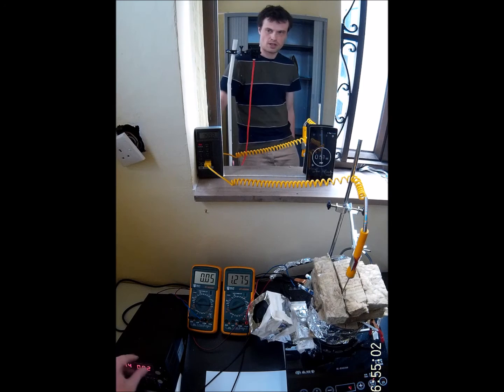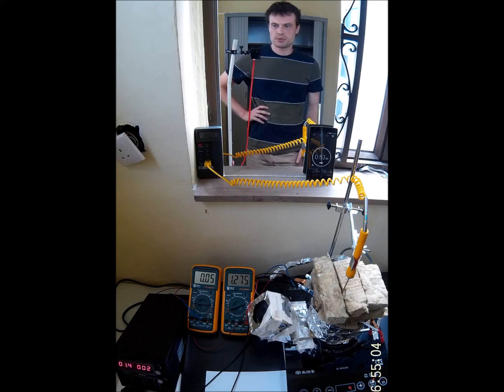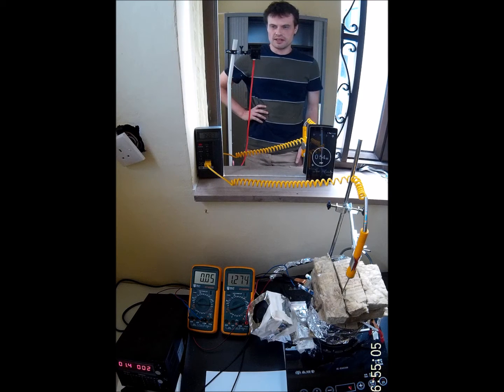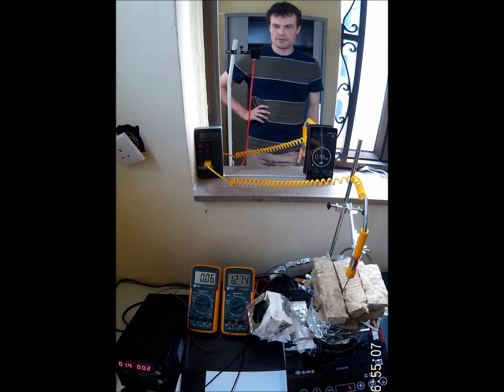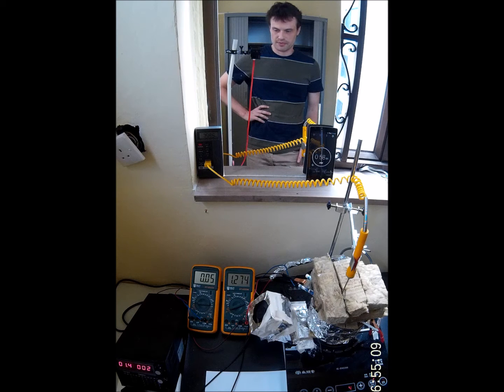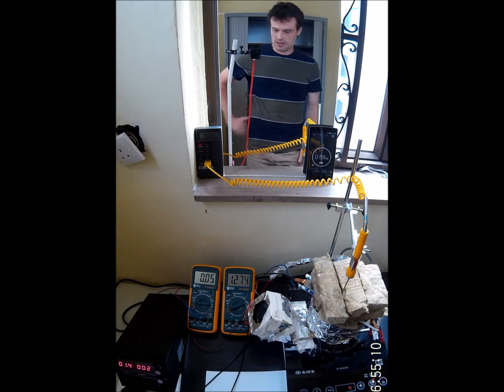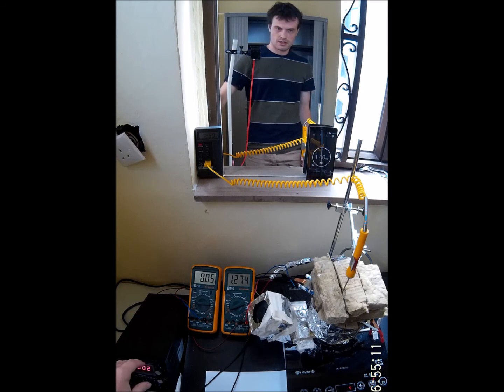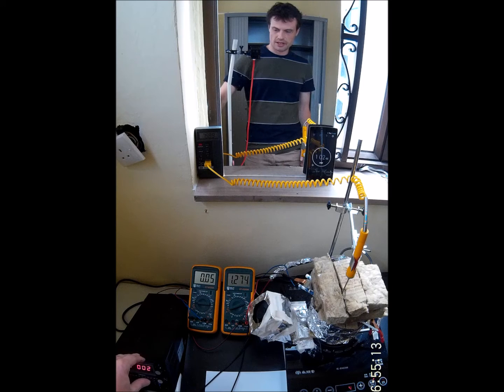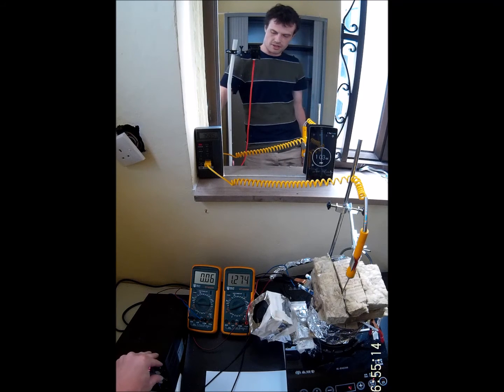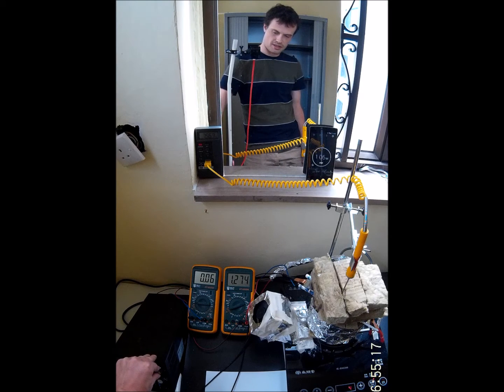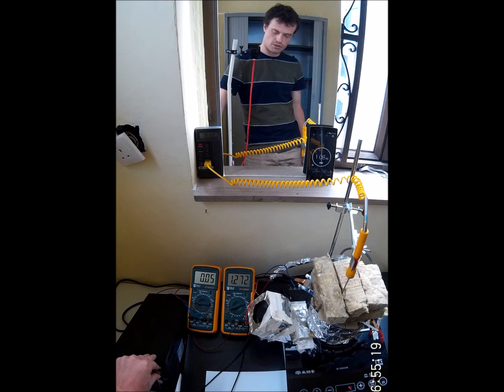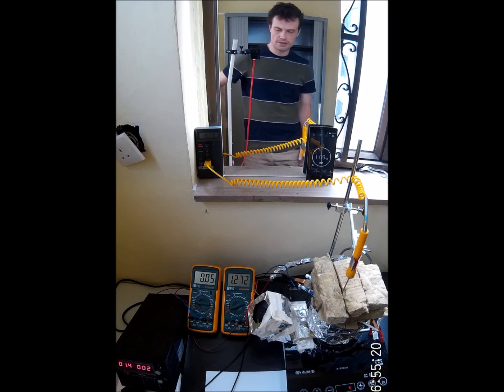I'll try to keep a temperature between 750 and 760. The higher the temperature, the easier current flows through the electrolyte.